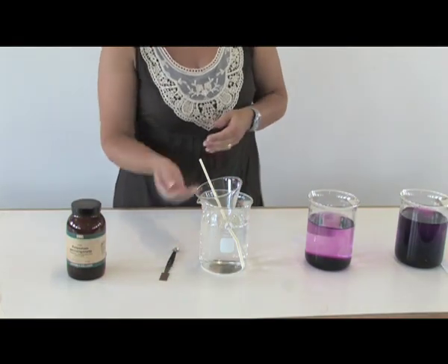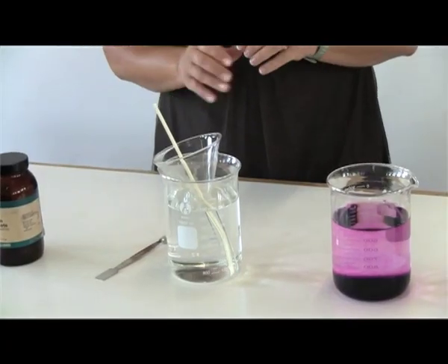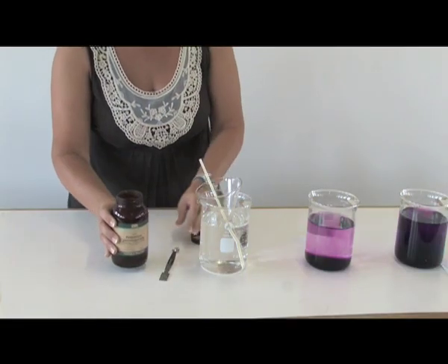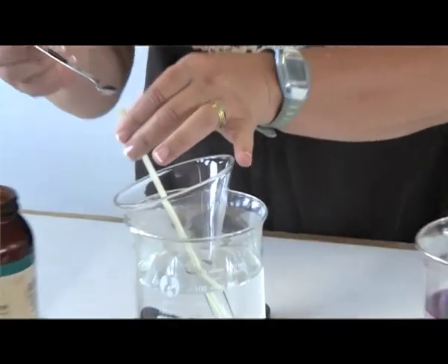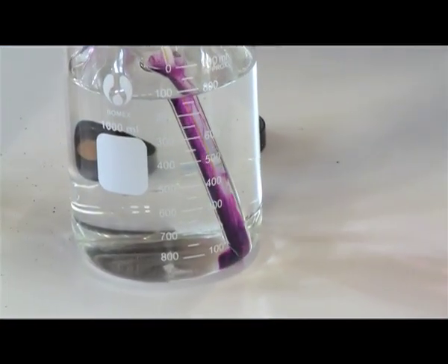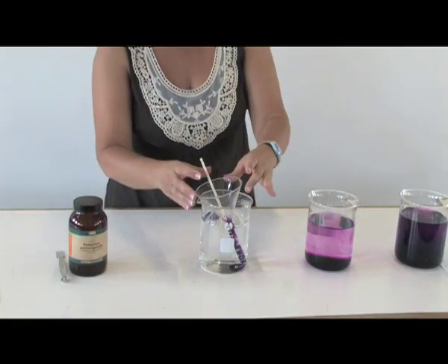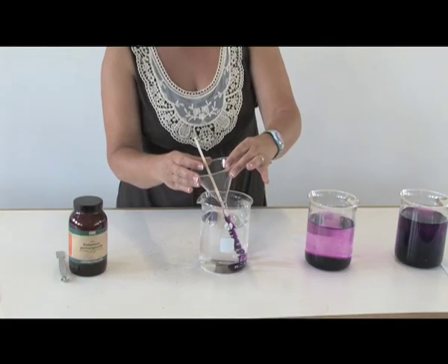We will need a large beaker filled with water — allow the water movement to stop before you put in a funnel. I also need potassium permanganate crystals, and I will place a few small crystals into the straw that is inserted in the funnel.